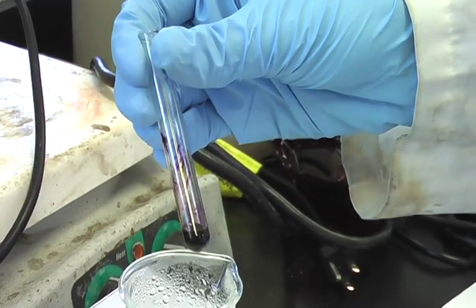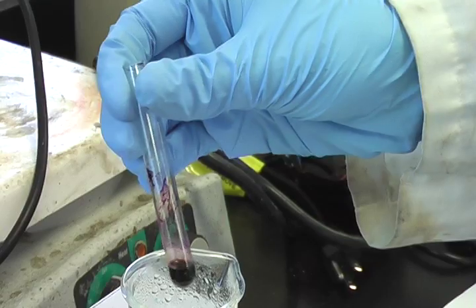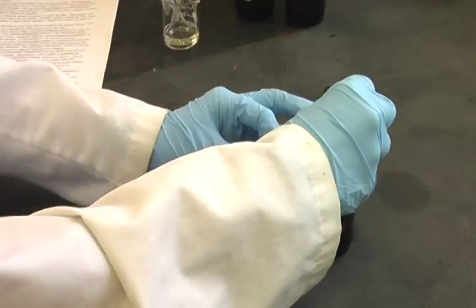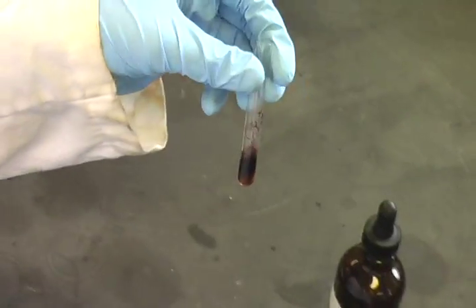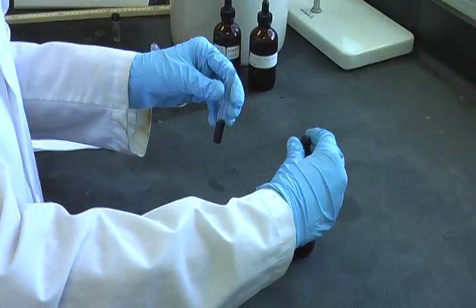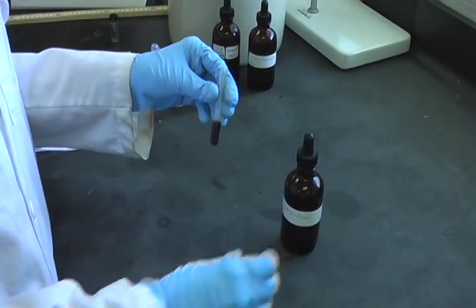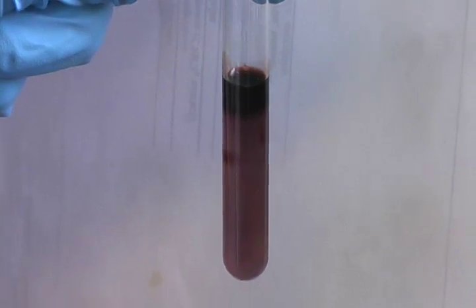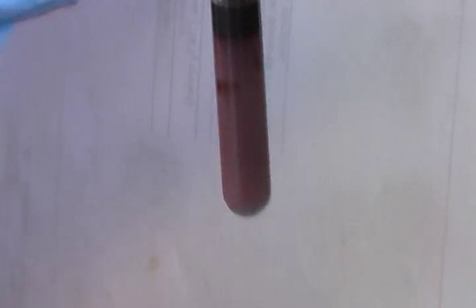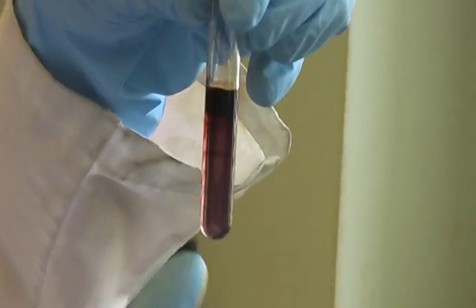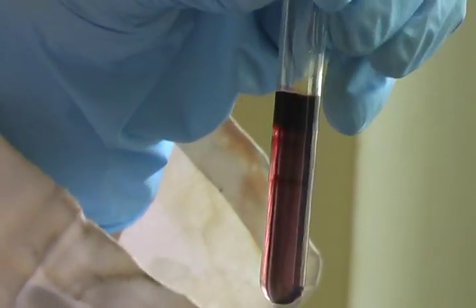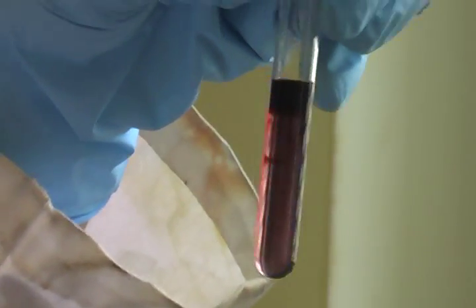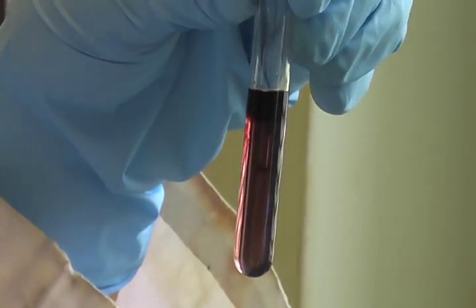A chromophore is the part of a molecule responsible for its color. After the test tube has been cooled, chloroform is added to the test tube and shaken for about 20 seconds. More chloroform is added to aid in the partitioning of the THC into the organic layer. Due to the purple color, the presence of THC can be confirmed. Notice how the THC has partitioned into the bottom layer because it is soluble in the organic layer but insoluble in the aqueous layer. This is because THC is fat soluble.